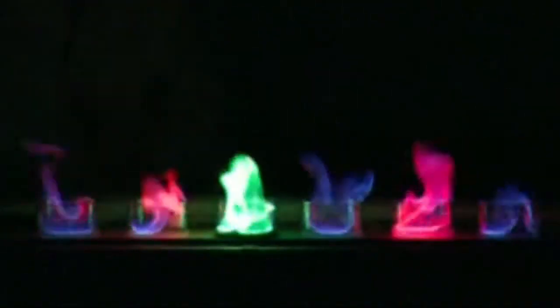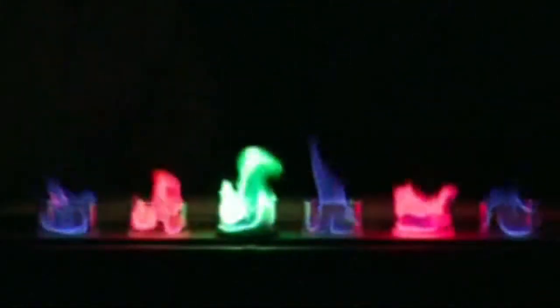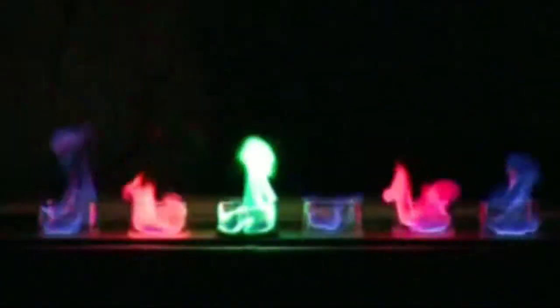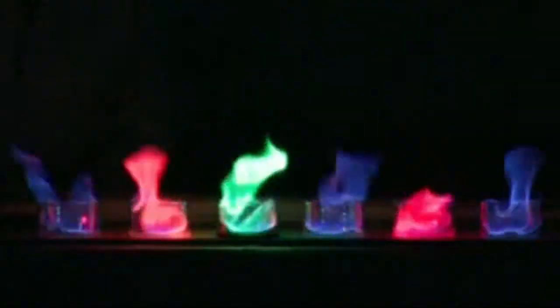So the reason we see these flame colours is all to do with energy. Before the solvent flame was lit, each of the metals within its particular substance is at its regular energy level state, or the ground state. When the solvent flame is lit, this provides enough energy to raise the metal to a higher energy level state, called the excited state. Now, metals don't stay in an excited state for long.